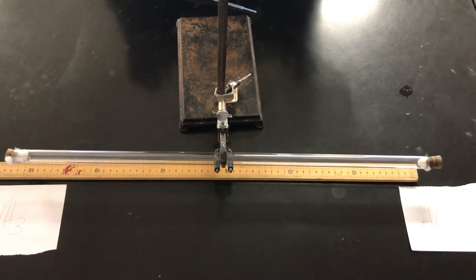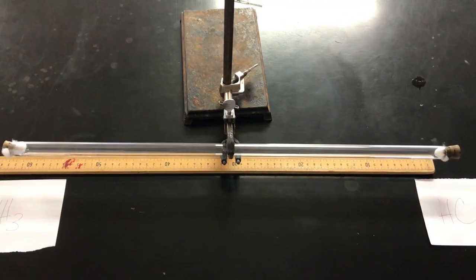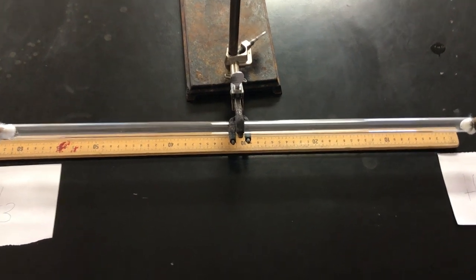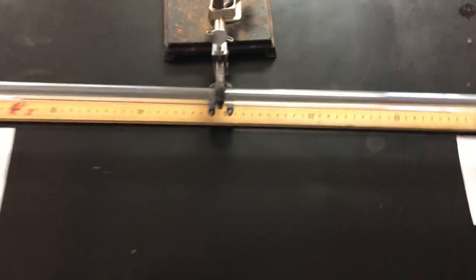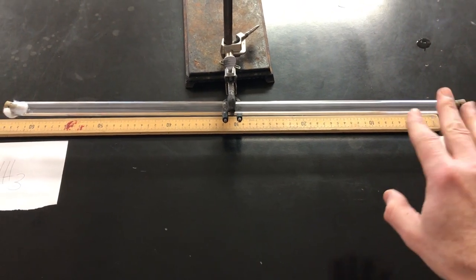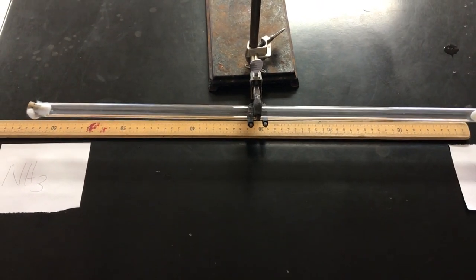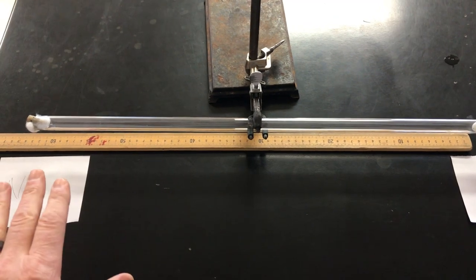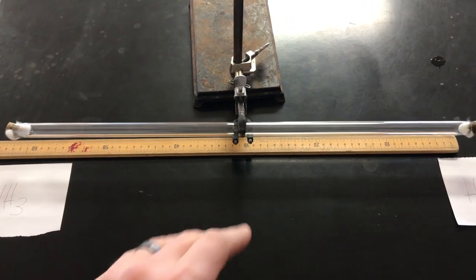Actually my fingers are burning a little bit. I'm gonna go rinse my fingers off while we're waiting. So the HCl is over here on the right. It's diffusing. Vapor is diffusing toward the ammonia. The ammonia is over here on the left. It's diffusing toward the HCl.